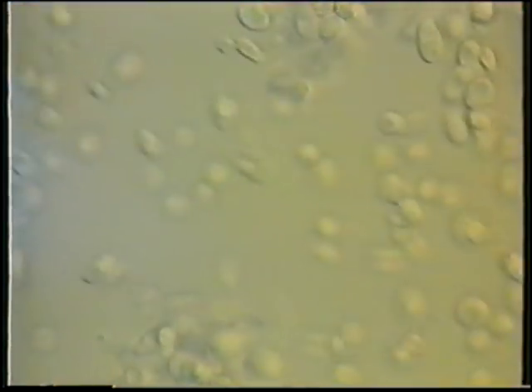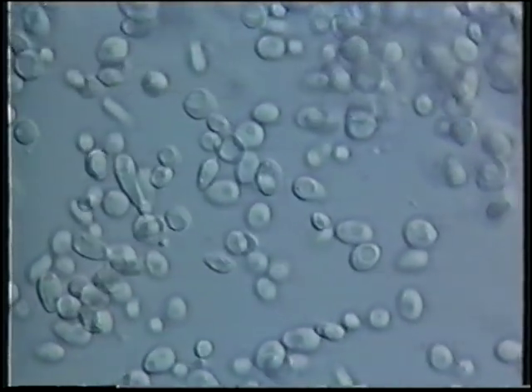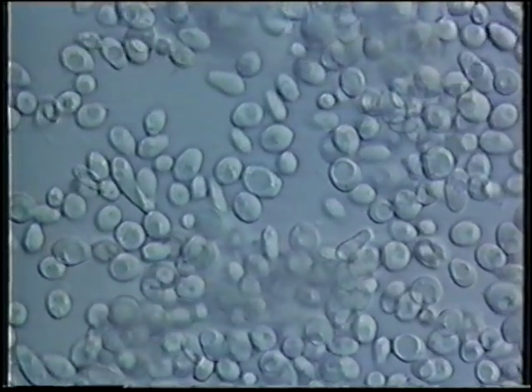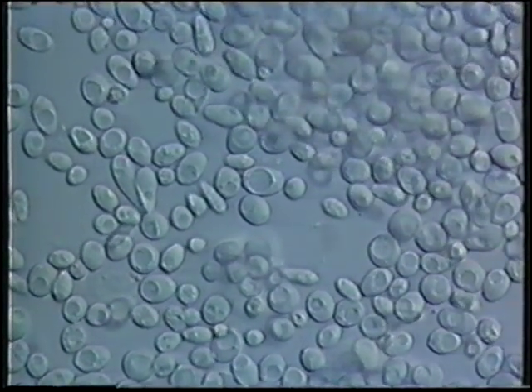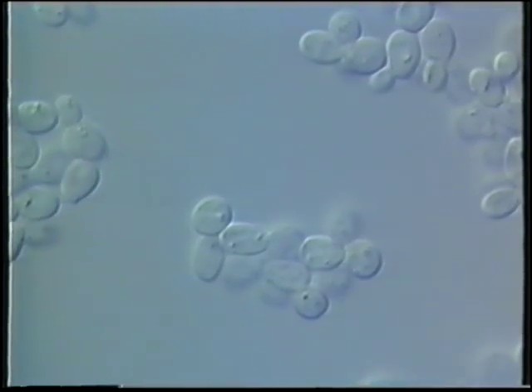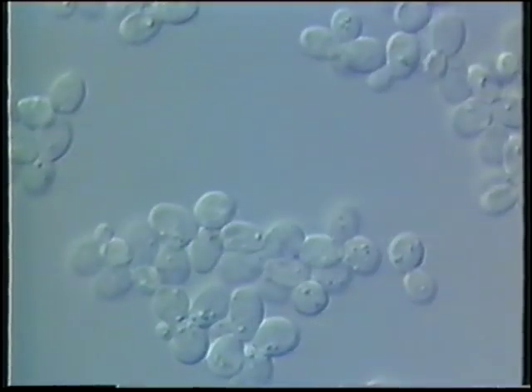Let's have a look under the microscope. We can see yeast cells only 5 to 8 micrometers long that convert the sugary extract into beer. Similar yeasts make wine and bread and many other products for us. Laboratory strains such as the ones we are now seeing play a central role in today's biological research.